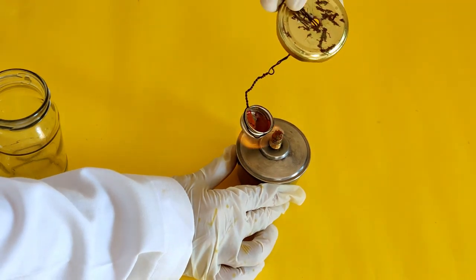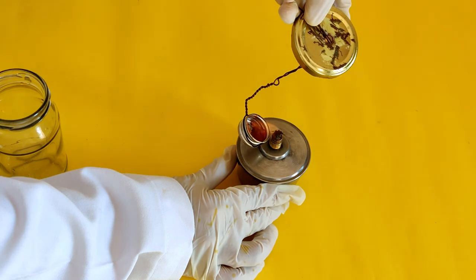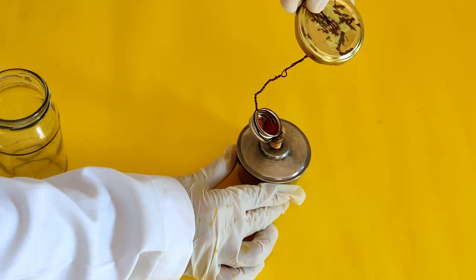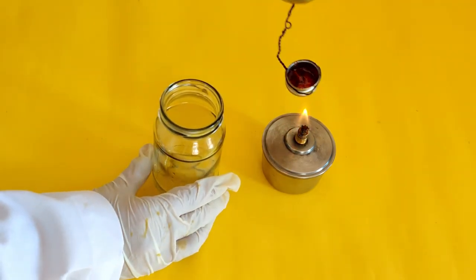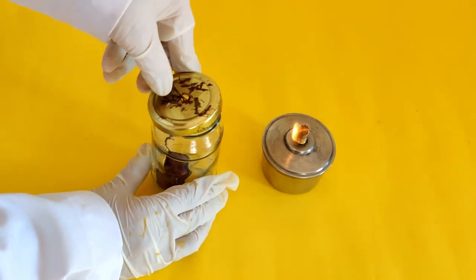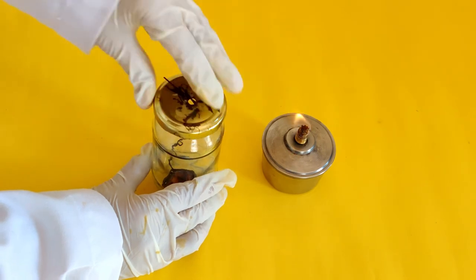You will see a gas is being emitted as the sulfur burns and sulfur turns liquid and reddish in color. Lower the cap into the glass jar and close the lid.